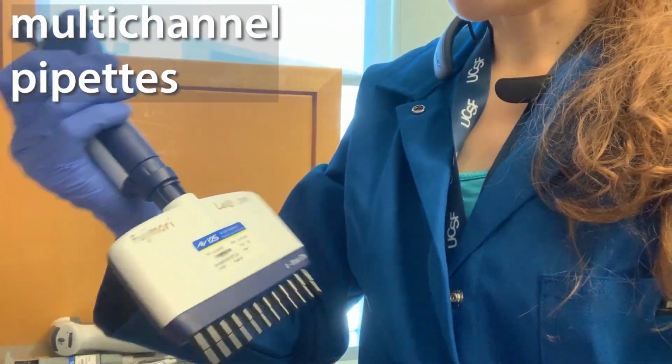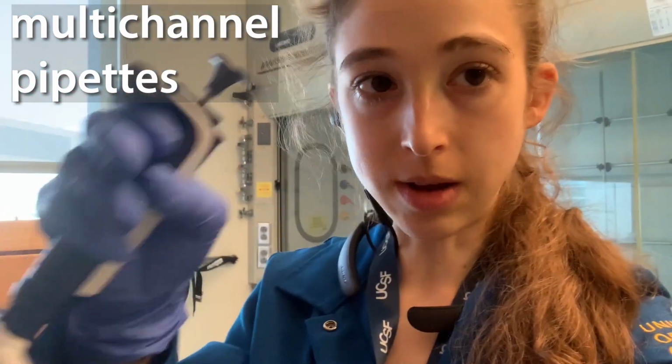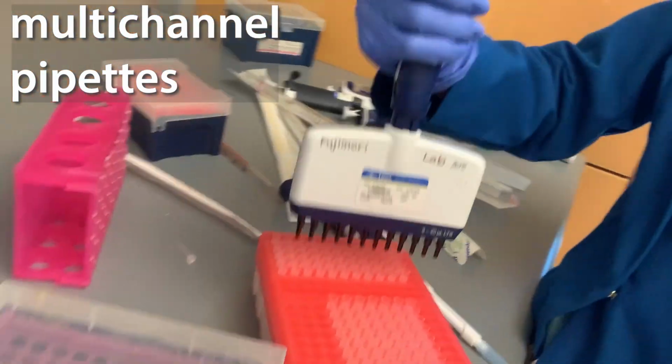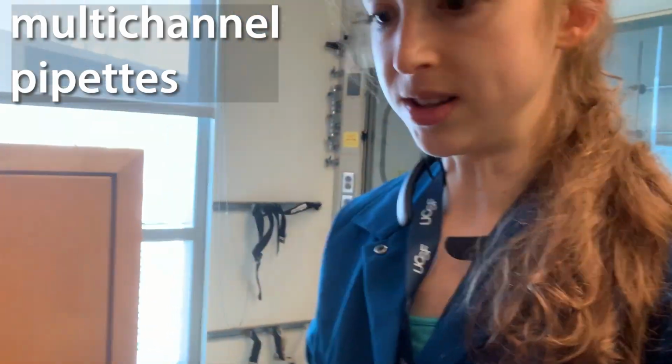Then you can set up your pipette rack or whatever to have how many samples you need in order to do that, and then you can just move it from place to place if you need to when you're organizing your rack. It's always good to keep an extra empty rack, so that when you're doing your rearrangements, you have somewhere to put the ones that you just took out.